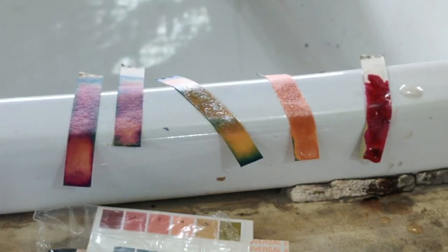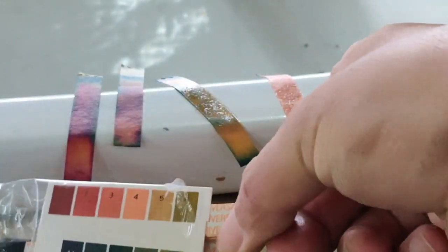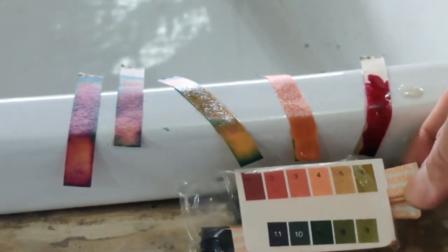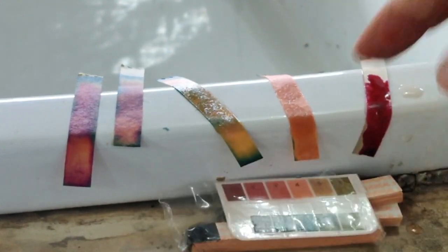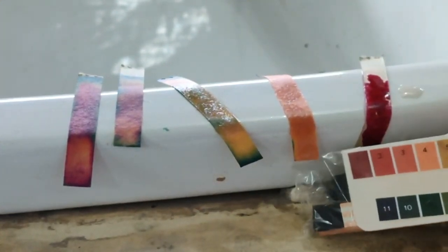It will take time, so I can't wait long, or else the video will go very long. But you will see that the color is different for different papers, so it is not the same. So again I am repeating, you have to match the color with this paper. As you match whichever color it is matching with, for example if I want to match here, I think this is what it is matching, you see number 4, and this paper, this one I am talking about, just look at that 4, and if you look at this one, then I think it is matching 2.